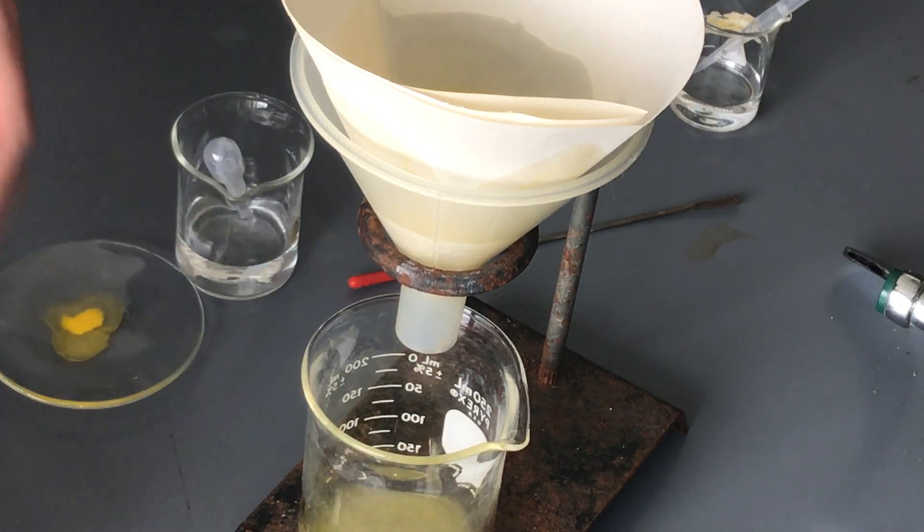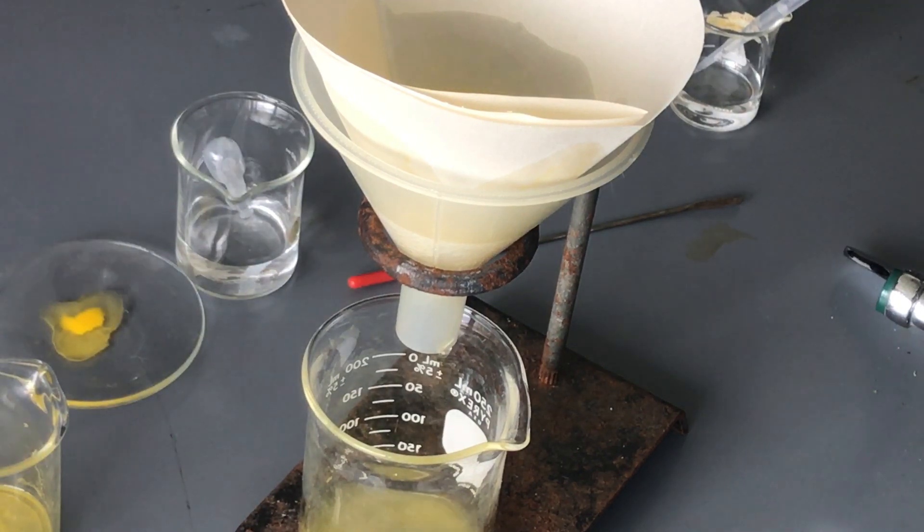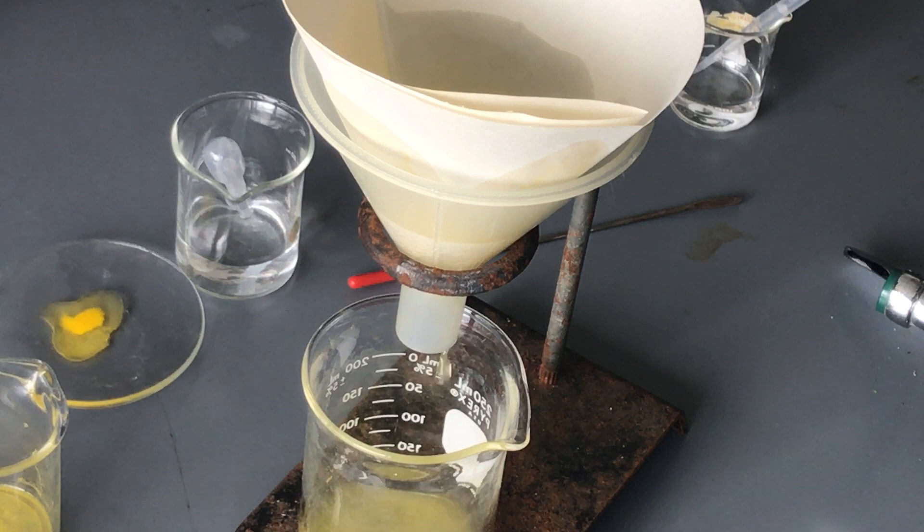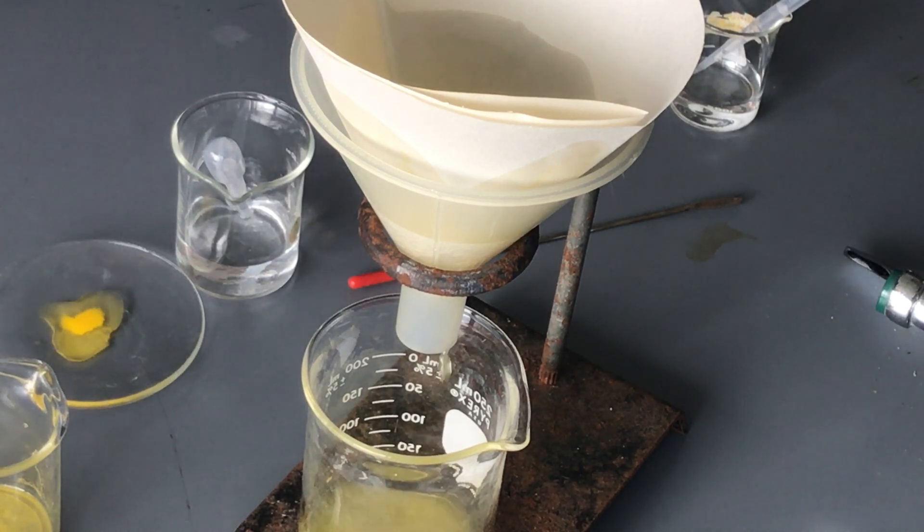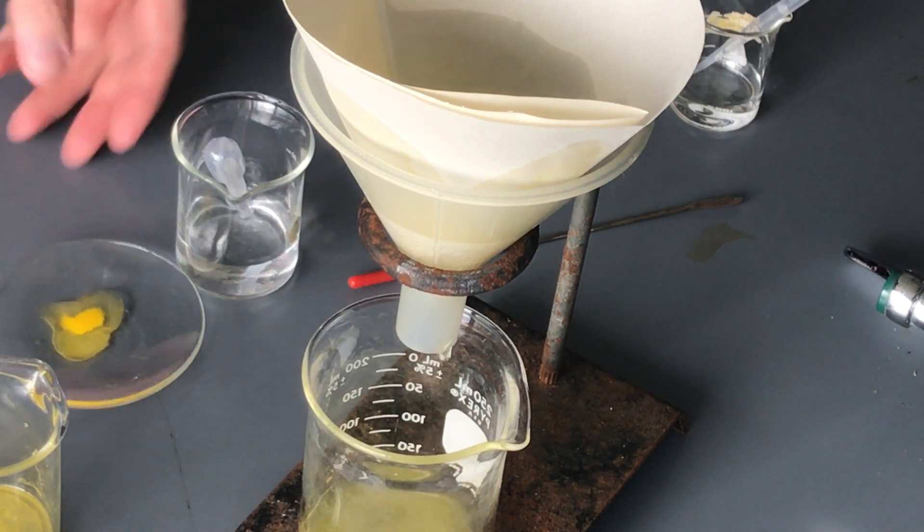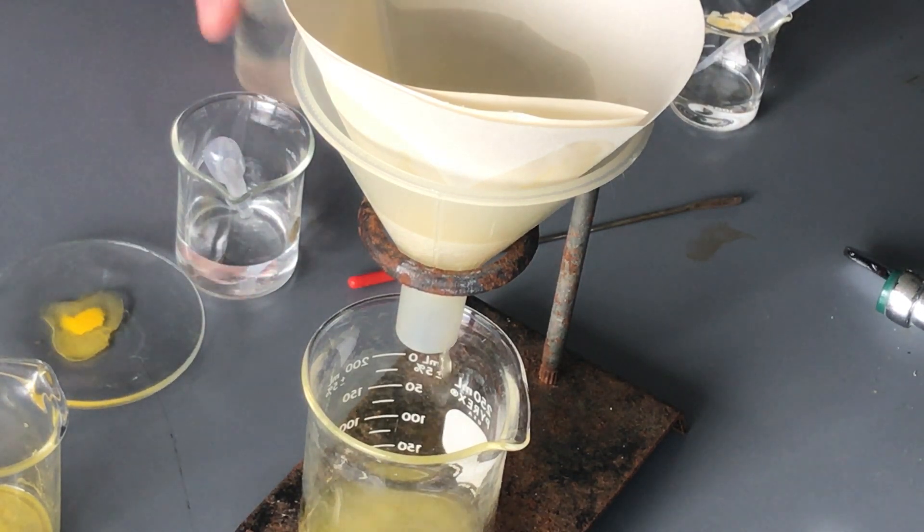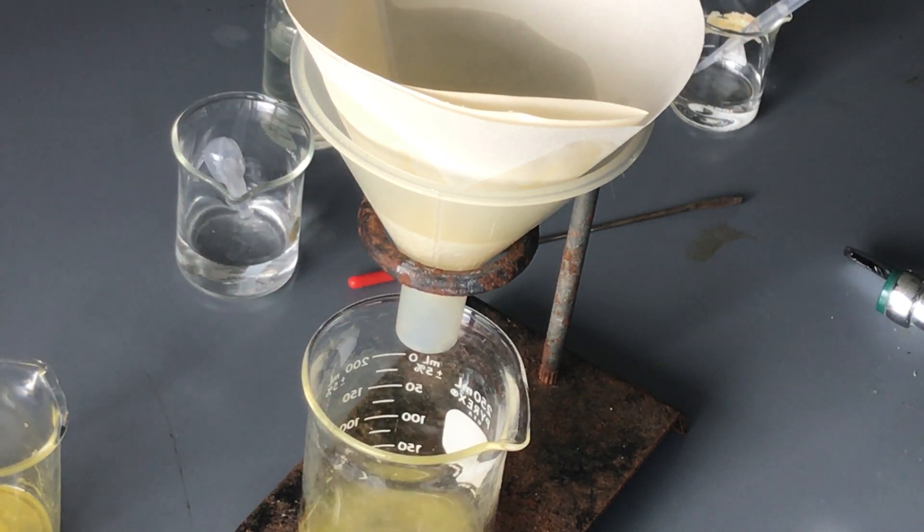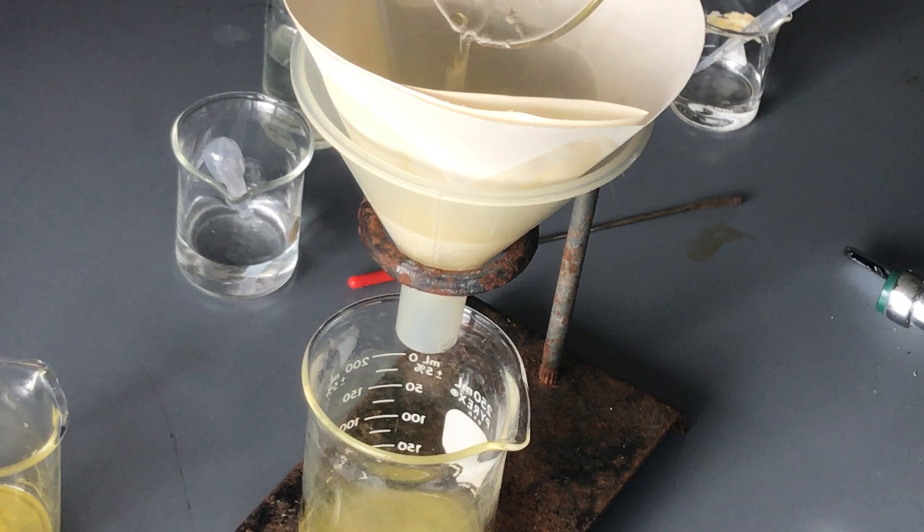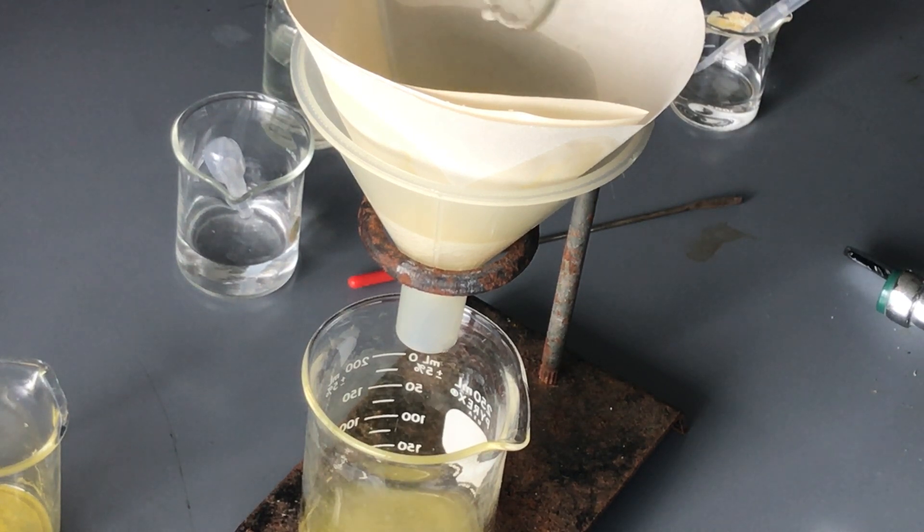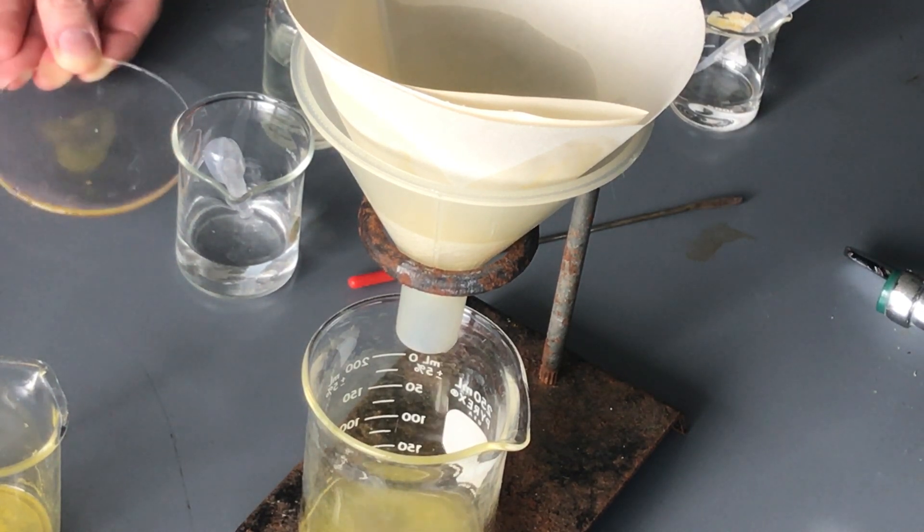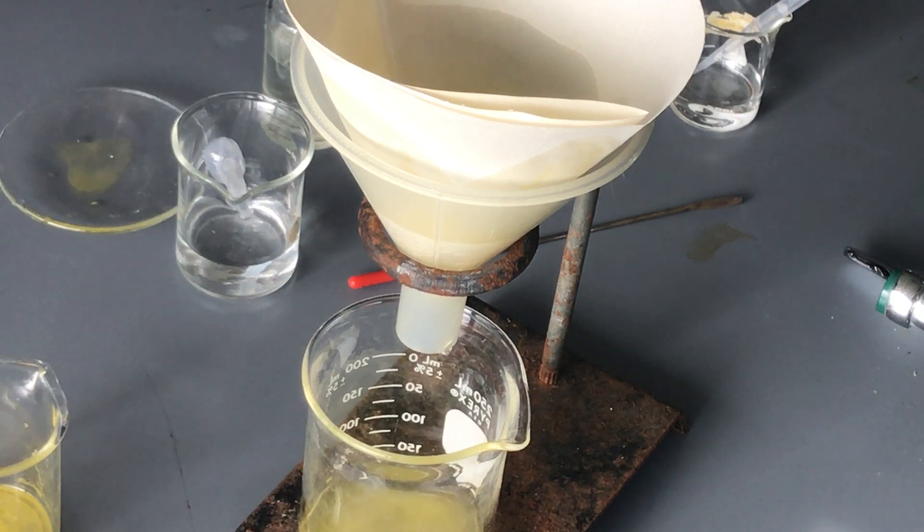And what we can do is appropriately let it dry up and then I can bag it in a plastic baggie. And then we have appropriate people who will come and will actually disseminate or dispose of it appropriately so it's not getting into the water supply and not getting into the food chains or not getting into the garbage and burnt and into the air that we breathe. So filtering of course is one of the best methods.